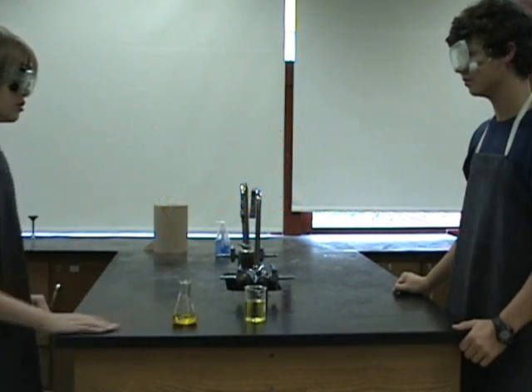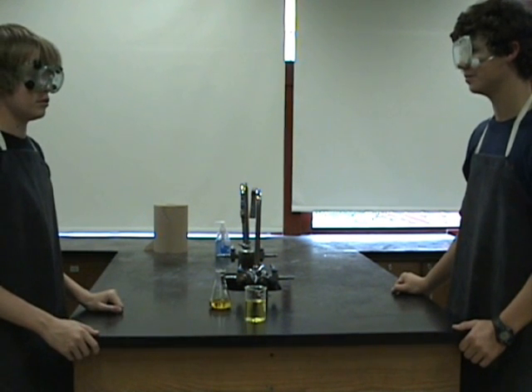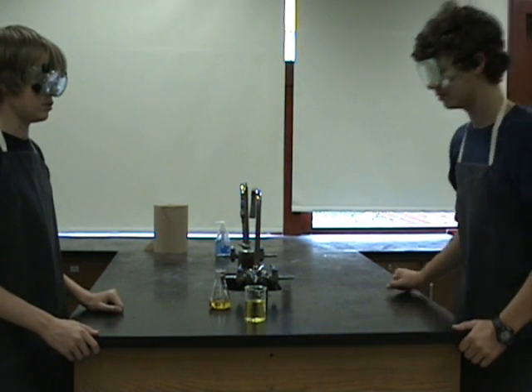Now that's done, should we smell it using a direct or wafting method? We should use the wafting method. You should not smell any chemicals in the lab unless instructed to do so. Let's see the proper technique for wafting.